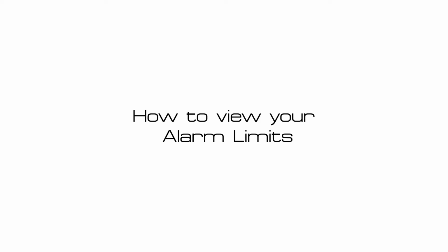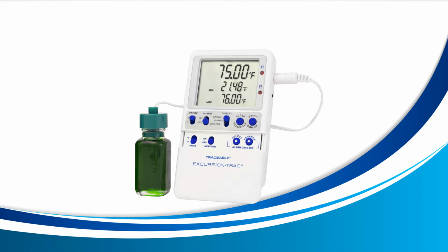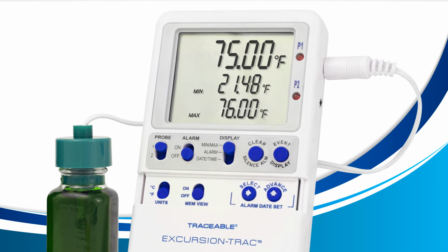How to view your alarm limits. To view your alarm limits, we're going to use the display switch on the center of your device. Move this switch until it aligns with the words alarm.